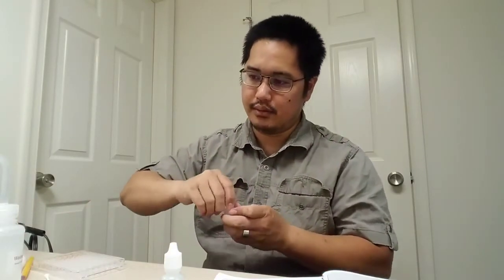And I'm going to put the reverse of the Na2C2O4. That would be sodium oxalate. So I'm going to go 5. Is it right? Yep, 5 in the first well. So A12 gets 5. 1, 2, 3, 4, 5. B12 gets 4. 1, 2, 3, 4. 1, 2, 3. 1, 2. And a measly 1.